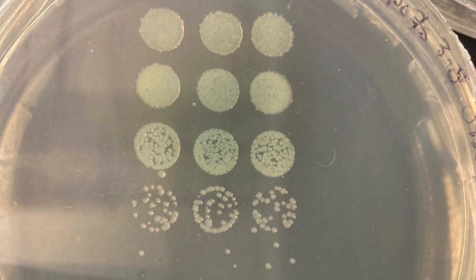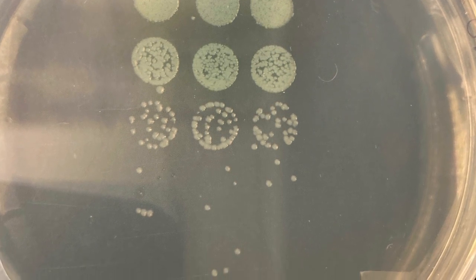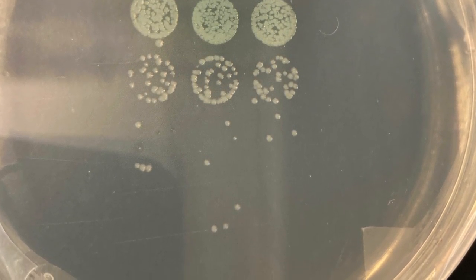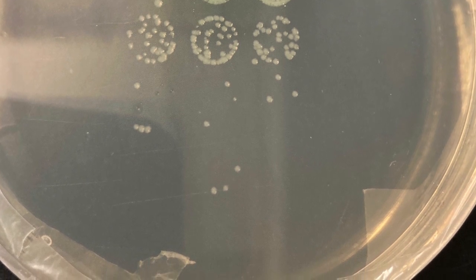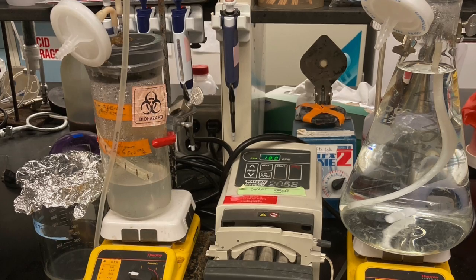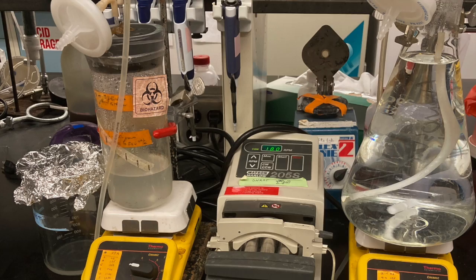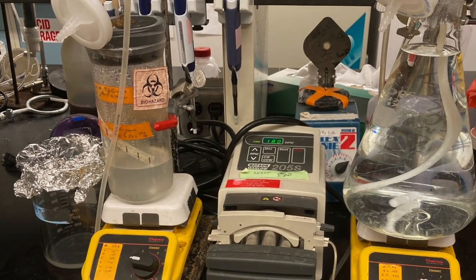After the chemostat setup is complete and run for 24 hours, about 1 residence time, an OD concentration curve can be identified by taking a spot plate of the chemostat sample. The chemostat will now supply a continuous sample of your target organism. The target organism for this chemostat is Pseudomonas aeruginosa.